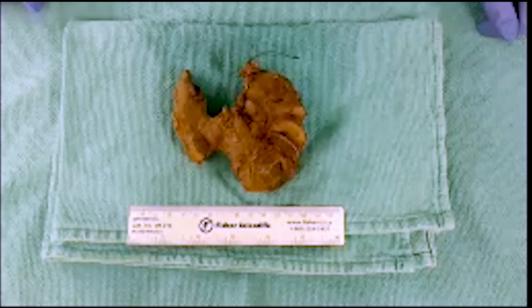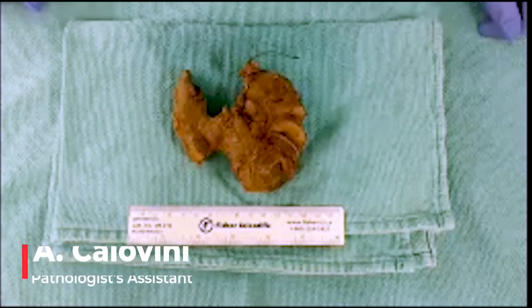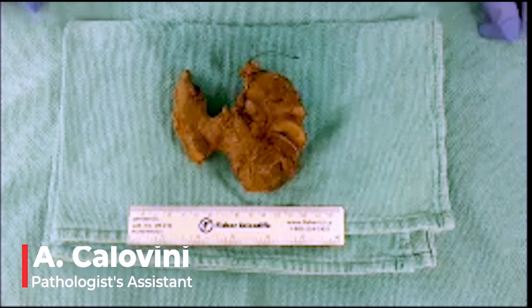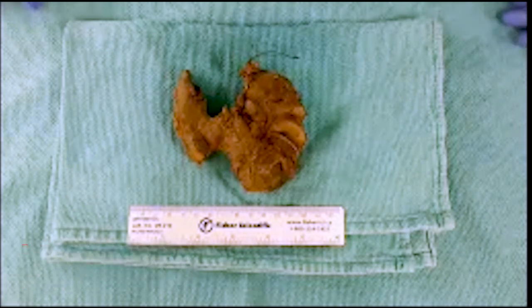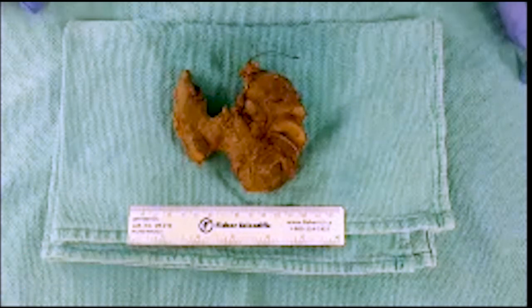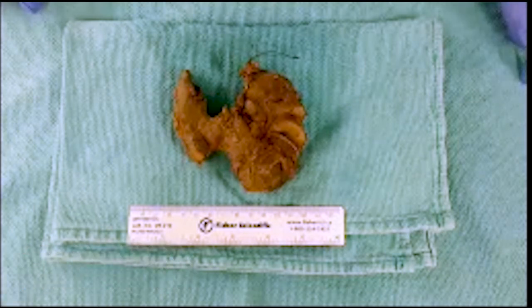Before you go with any specimen, you want to be checking your patient identifiers to make sure that it's consistent with what you're seeing in front of you. You also want to check orientation and see if that's provided.